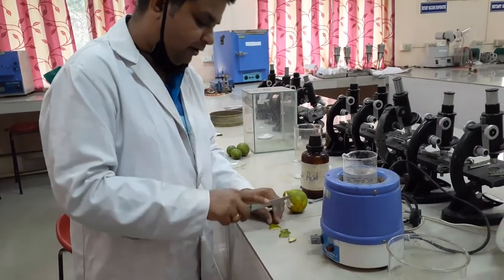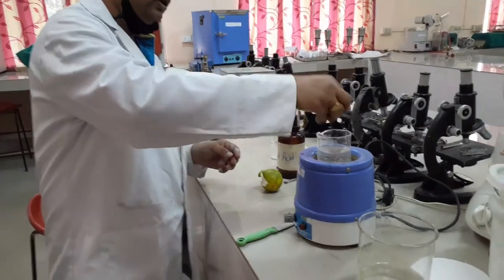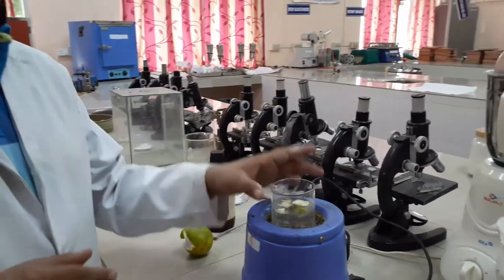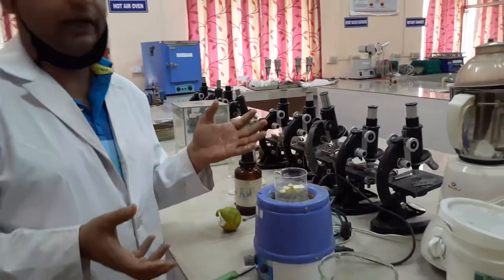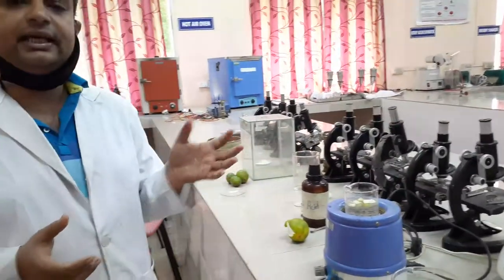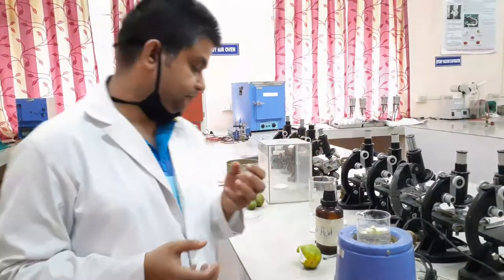Now, after cutting into small pieces, you put them in distilled water and heat at 100 degrees centigrade so that it gets boiled. The reason for boiling is that the cells get softened.